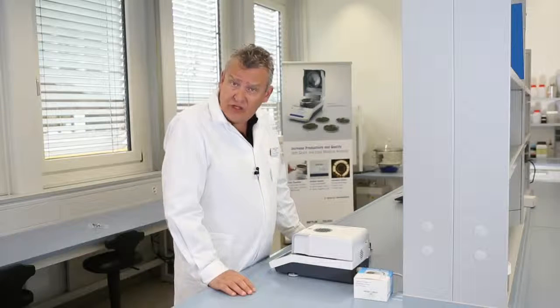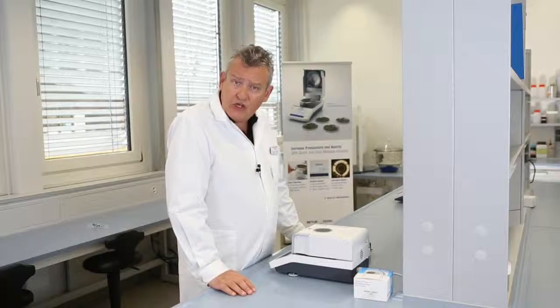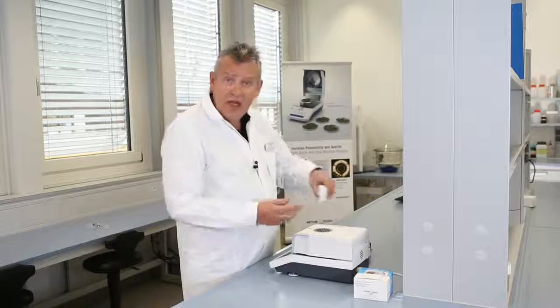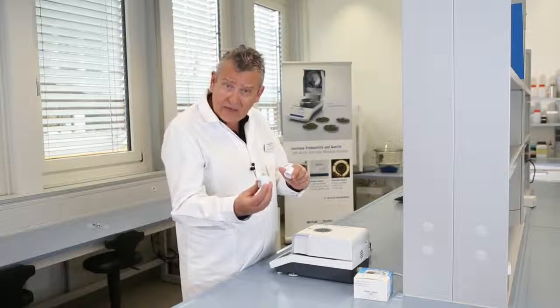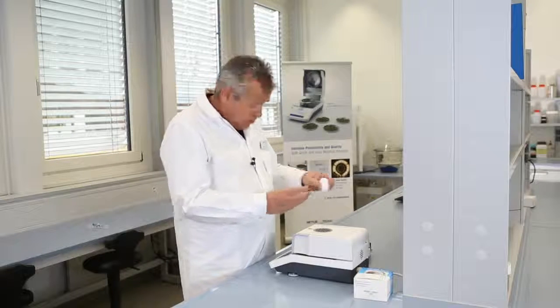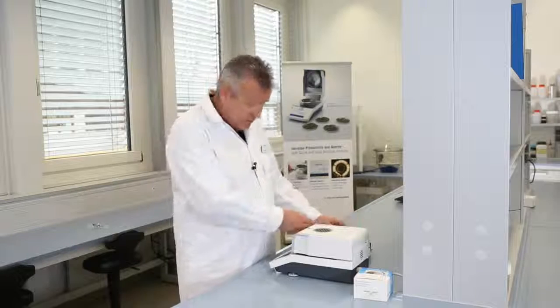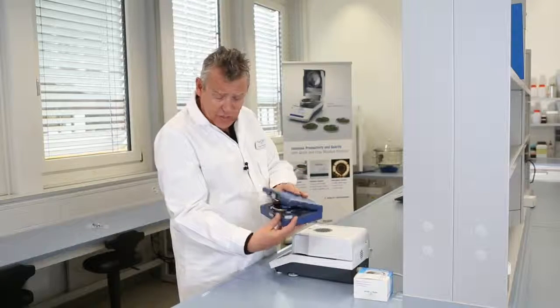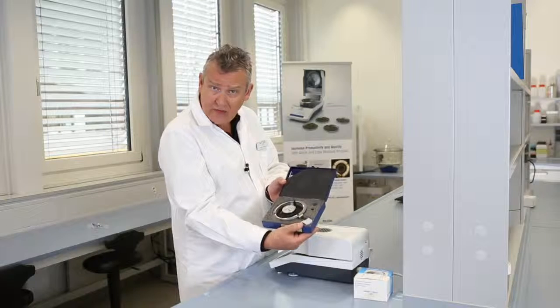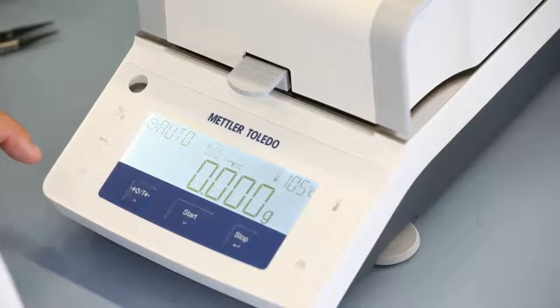If you want to adjust your instrument, you can adjust the weighing unit using a calibrated weight and you can adjust the heating unit using the optional temperature calibration kit.